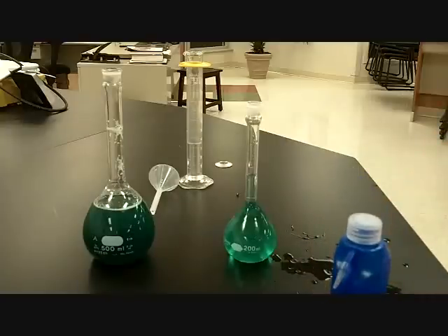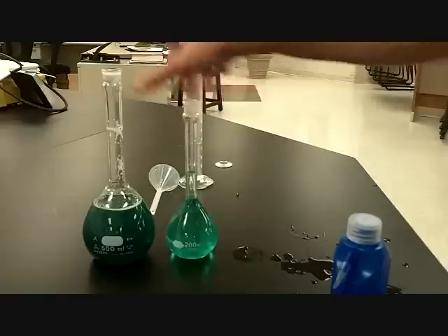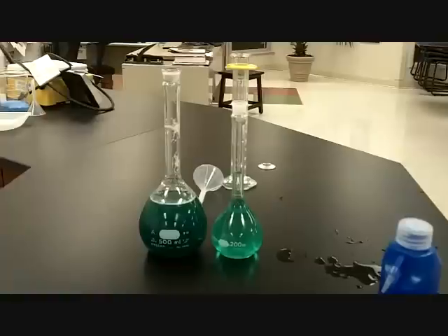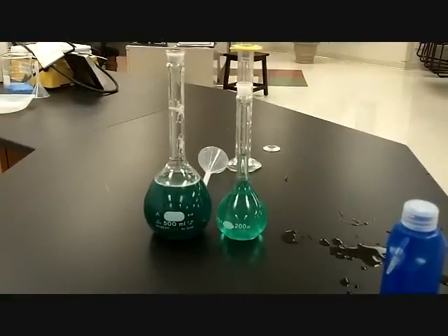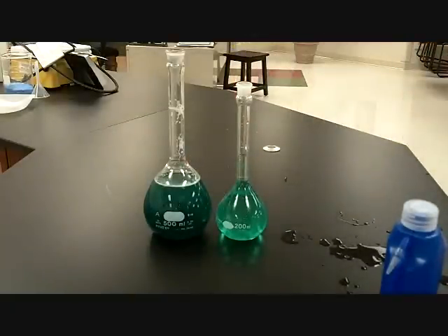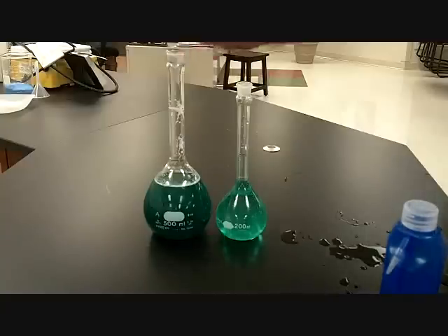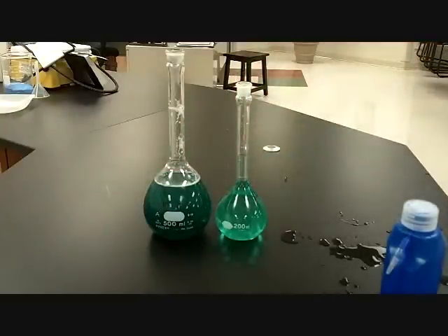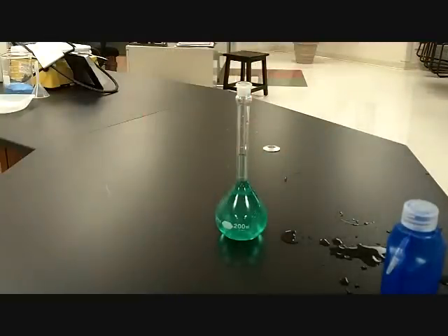Now, let's do a little comparison here. Samuel, how many years of chemistry have you taken so far in your lifetime? Zero. You've not taken any chemistry in your life. I'm asking your unbiased opinion: which of the two volumetric flasks looks darkest, the one on the left or the one on the right? Left, the one that's the 500 mL. So this is our concentrated solution, which should be darker because it has more nickel chloride than this one. I'm going to quickly pour out 54 milliliters of this myself.